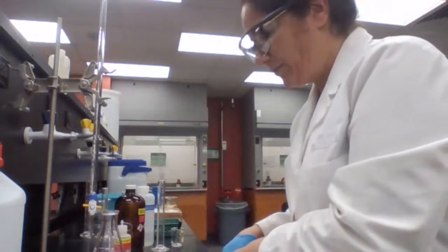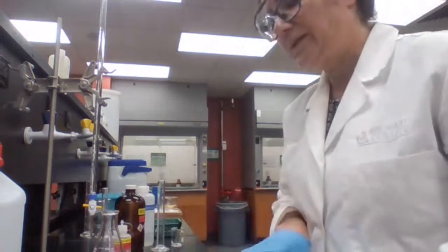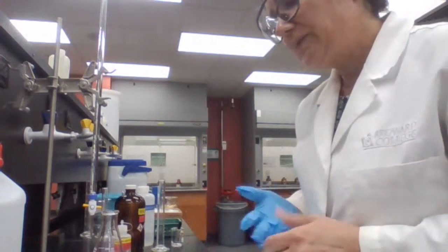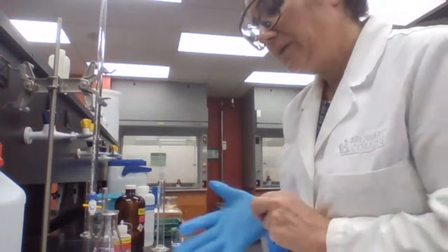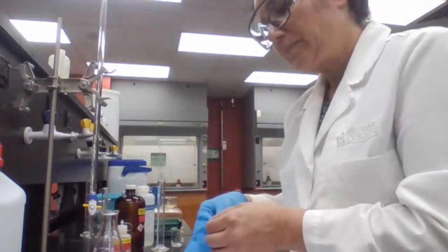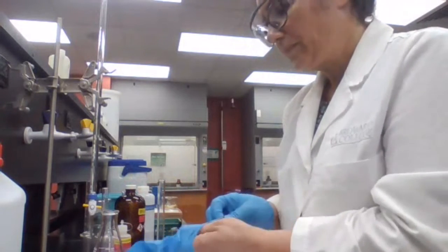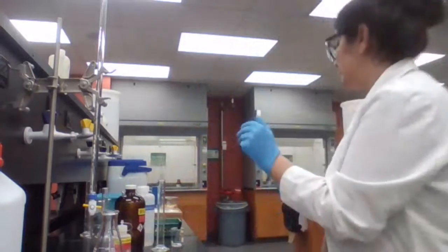Okay. So for the procedure for silver nitrate, I'm going to do the silver nitrate test.